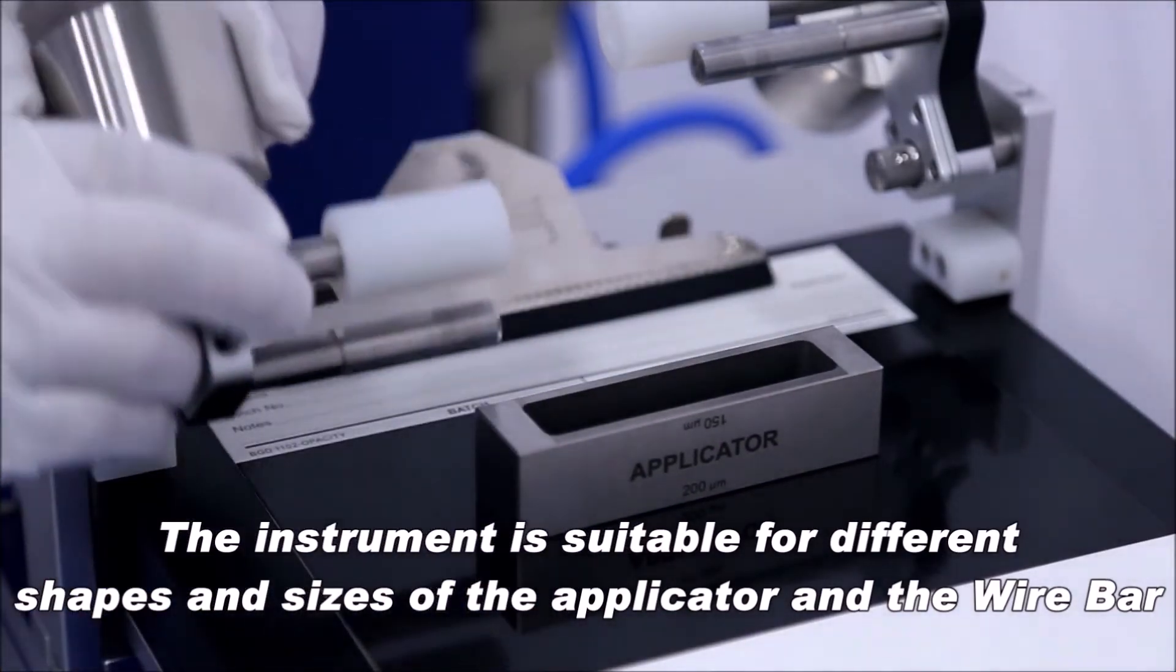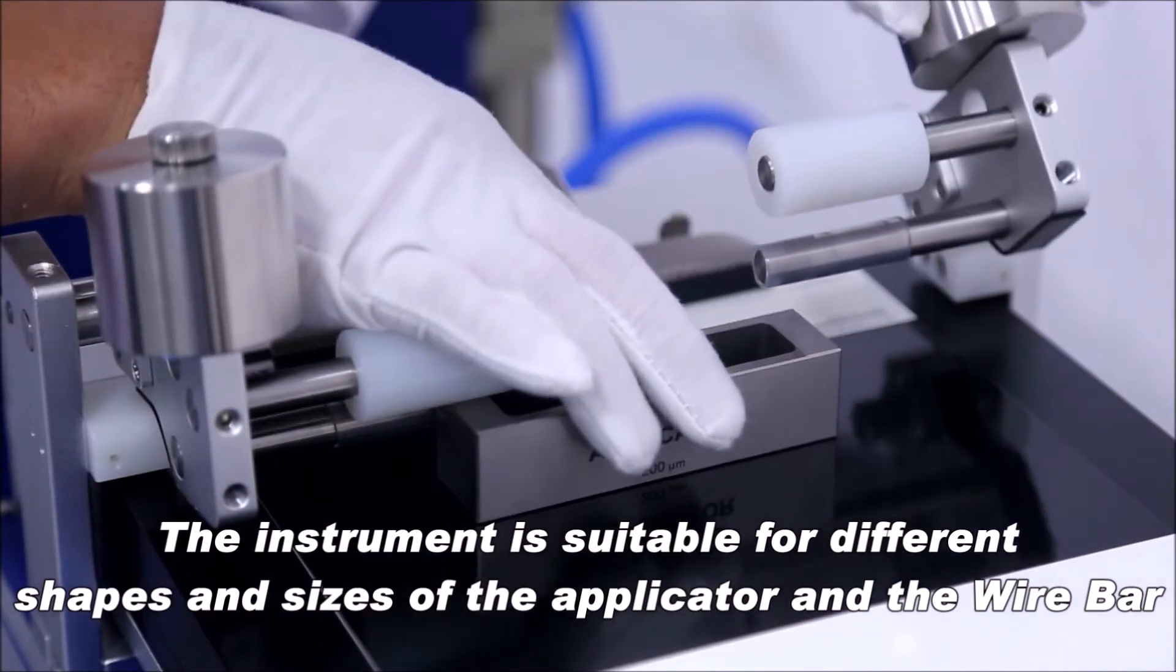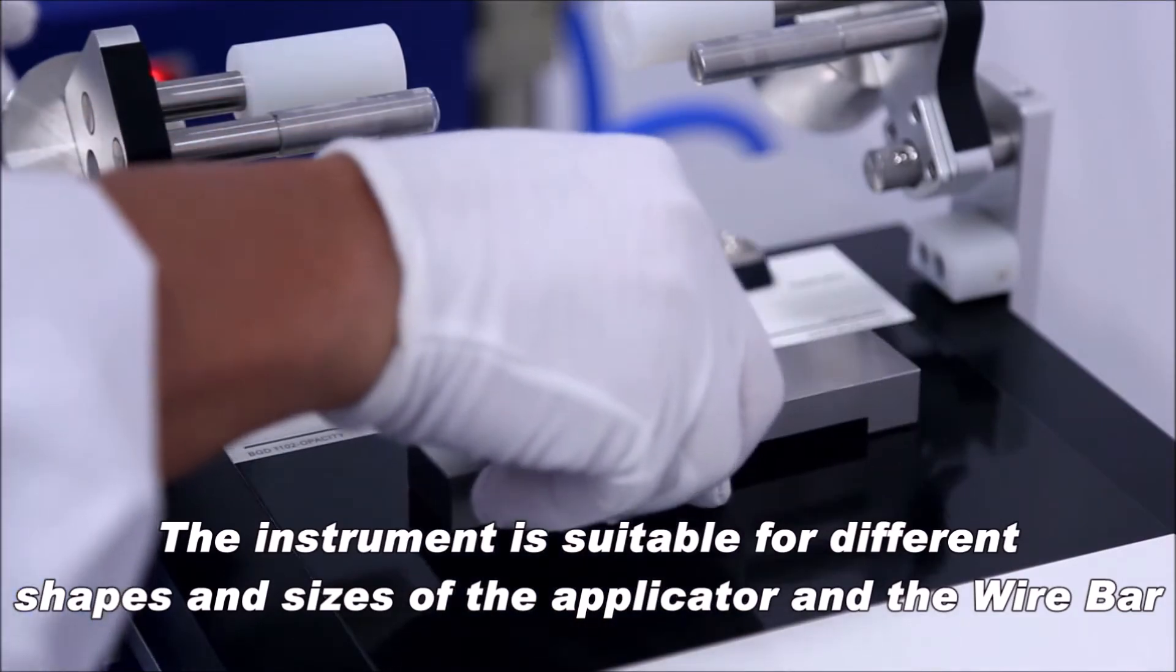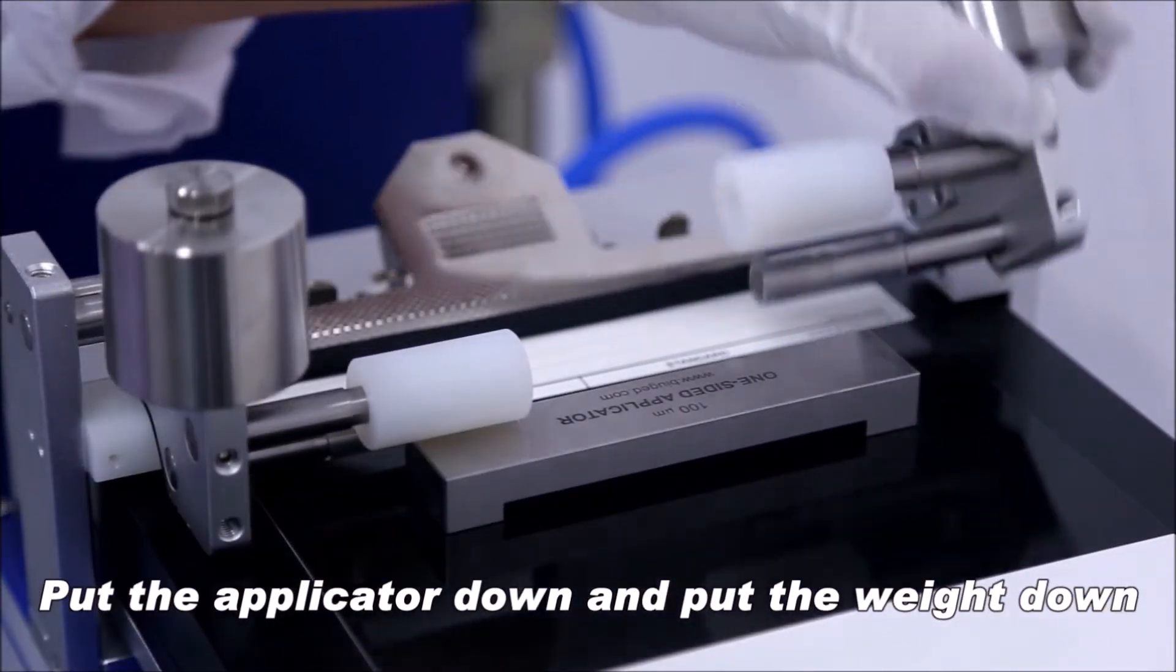The instrument is suitable for different shapes and sizes of the applicator and the wire bar. Put the applicator down and put the weight down.